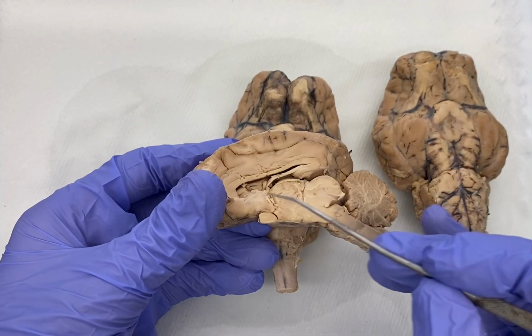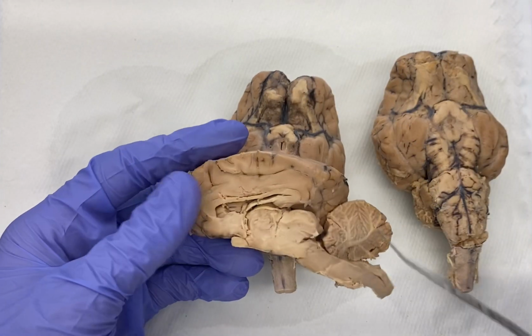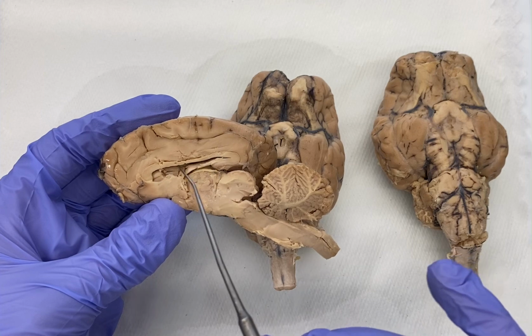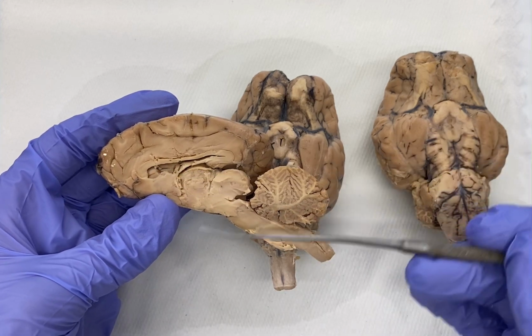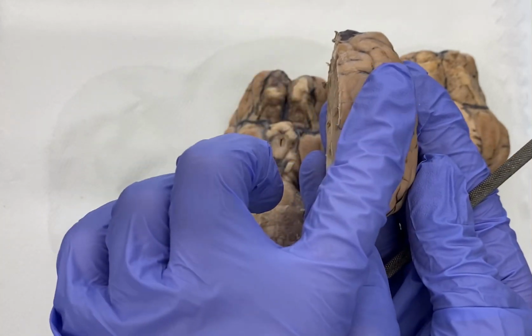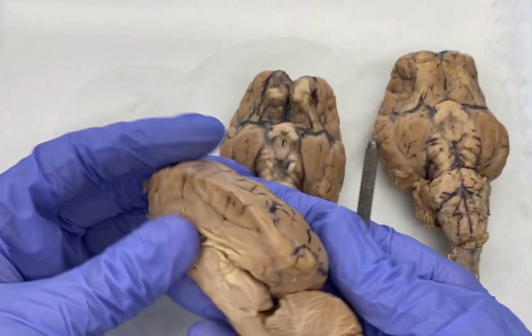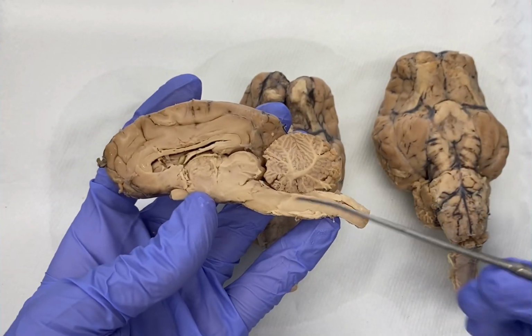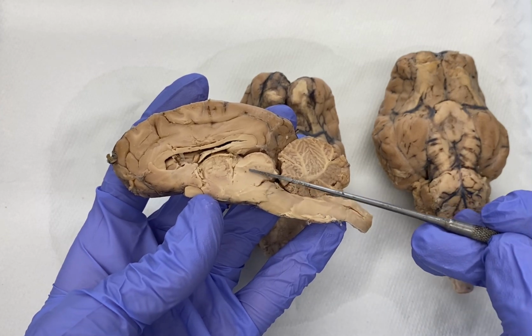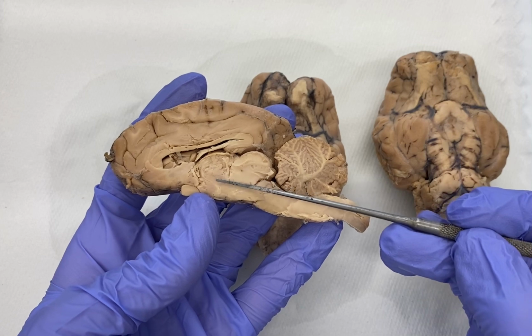This is one of our ventricles, and we have four of them. We have two lateral. So this is one lateral. The other lateral would be in the other cerebral hemisphere, but we've removed it. So there's one lateral over here, and there'd be another lateral on this side, but it's gone. So two lateral. You have what's called a third ventricle, which typically sits in this region called the diencephalon. So the third ventricle is here.